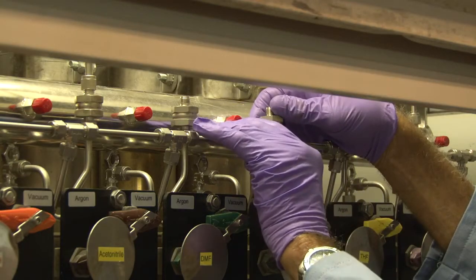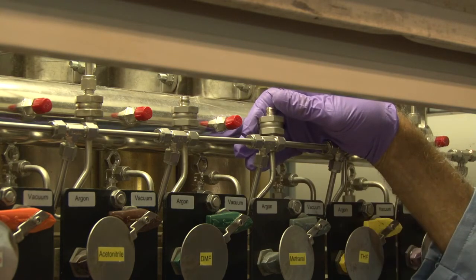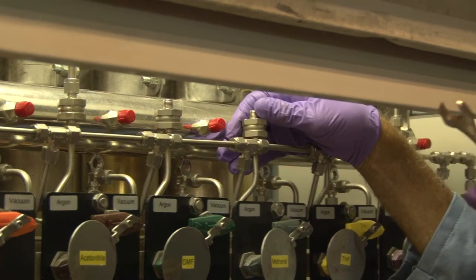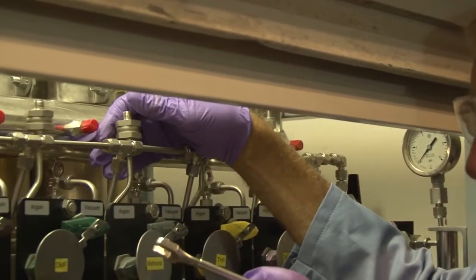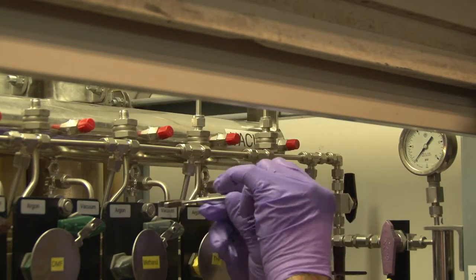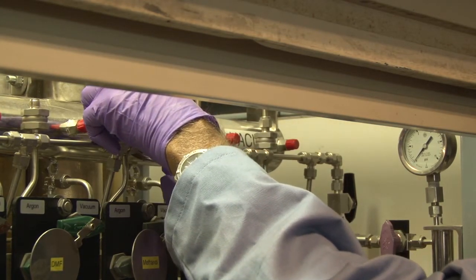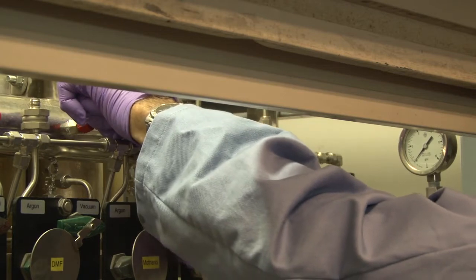I am reinstalling the filter, hand-tightening it first and assuring that the arrow points down, which is the direction of flow of the solvent. You need an open-ended wrench, 9/16, low profile — this is a homemade custom wrench because spaces are tight on some of these. Then assuring that everything is tight. It is basically the only mechanical procedure you have to perform.